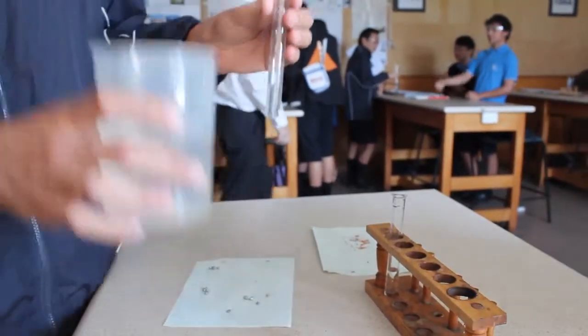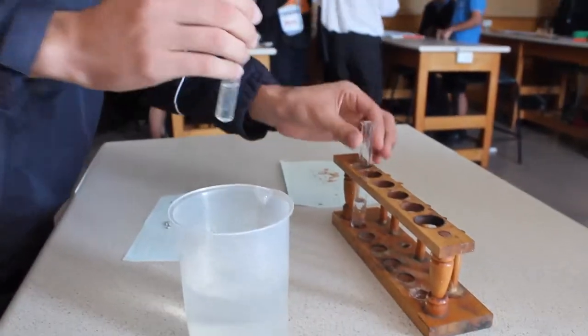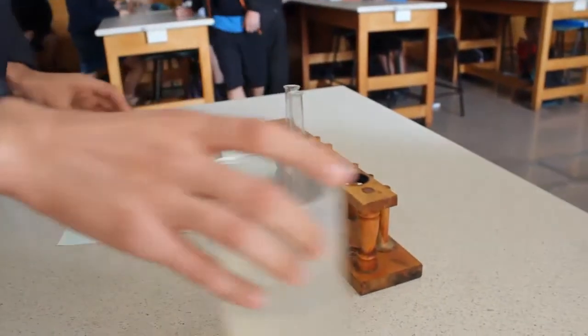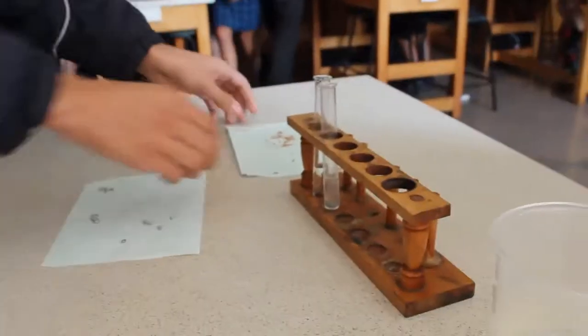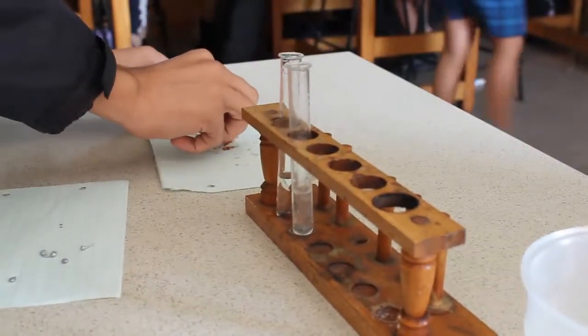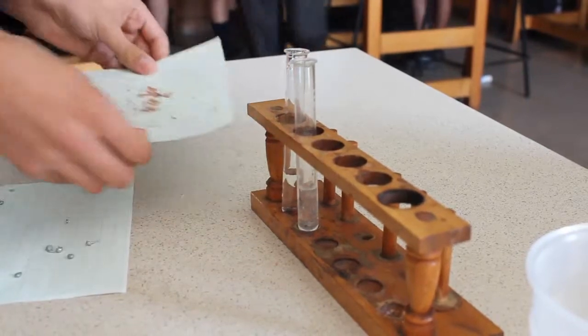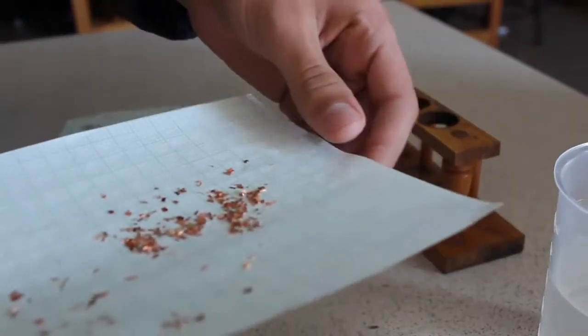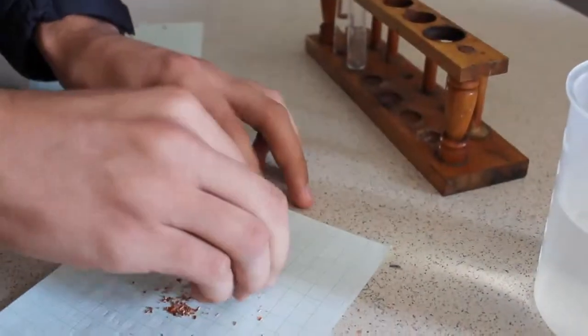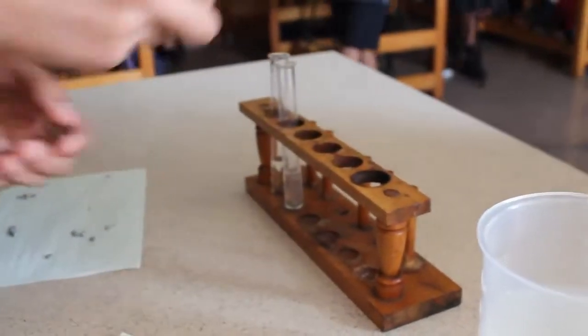Okay, so we want them relatively to be the same. And now this is the catalyst here. It's just copper shavings, and we're going to put a bit into one test tube, and only one, just to compare the reaction.